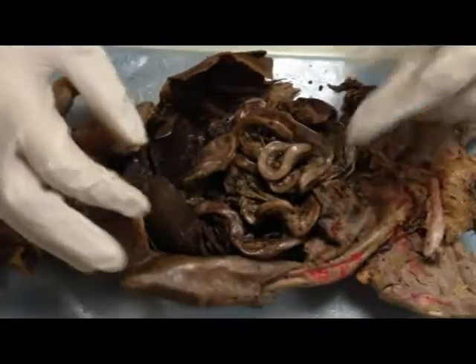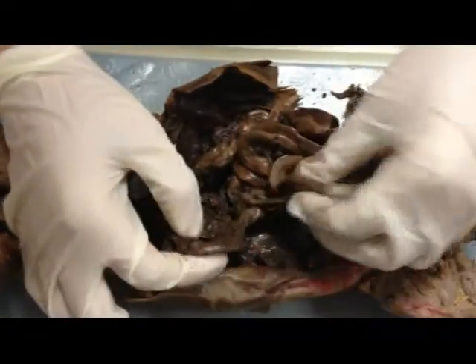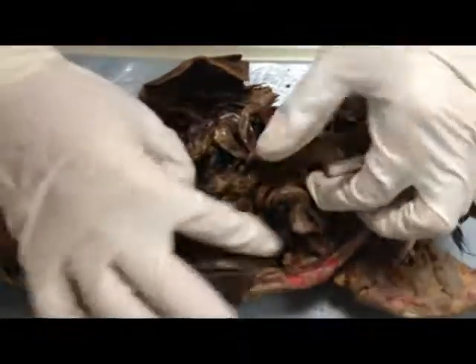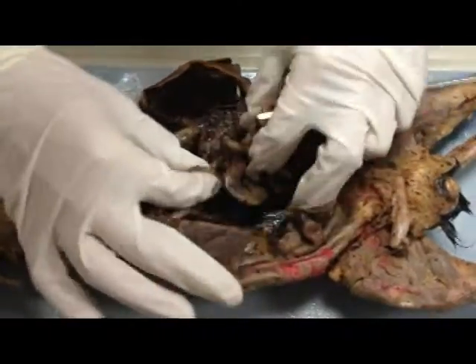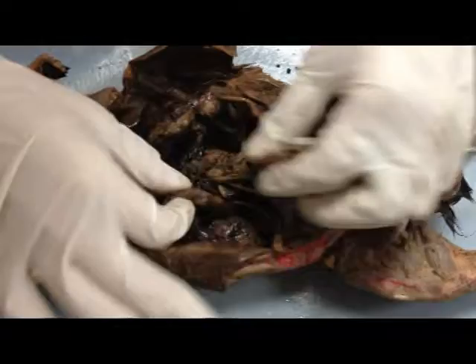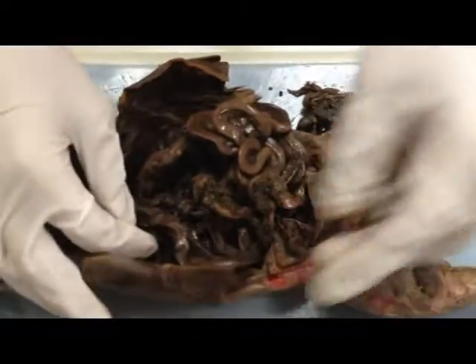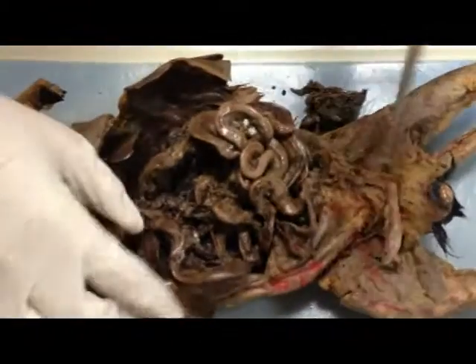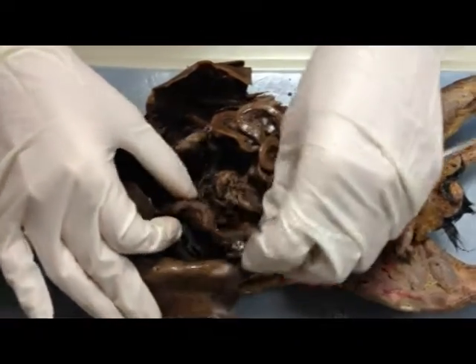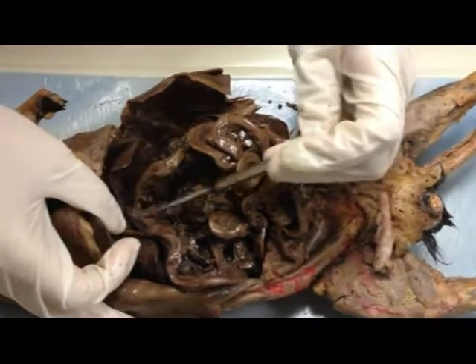Now you have the small intestines. The small intestines are a lot rounder than the large intestines — a lot smaller and rounder. So right here, these are examples of your small intestines. There are going to be clear differences between the duodenum, the jejunum, and the ileum. The duodenum is the one that comes right after the stomach.